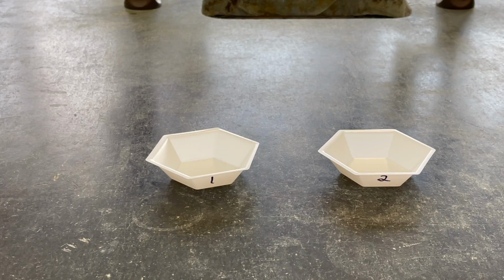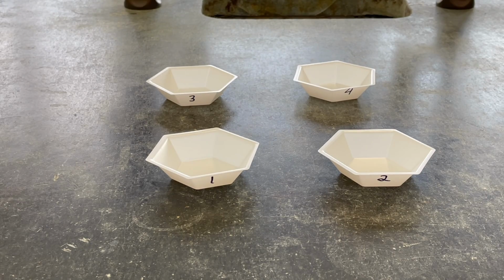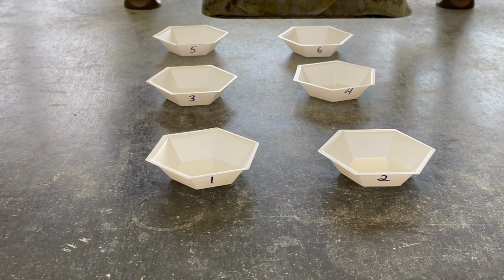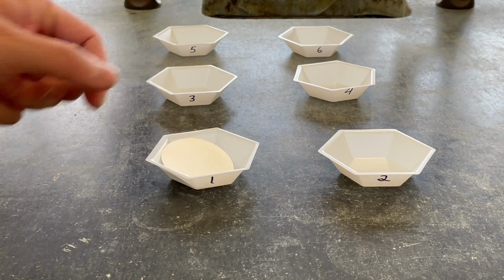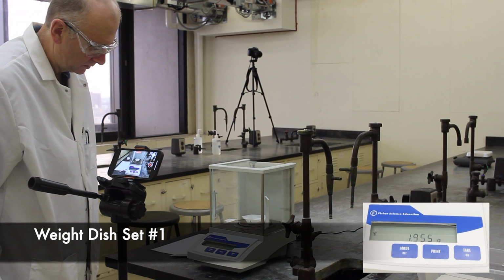While the beakers are on a hot plate, number 6 weighing dishes from 1 to 6, and place a filter paper into each. Measure the mass of each set and record them onto your data sheet.